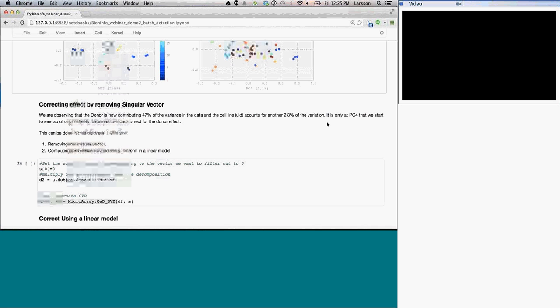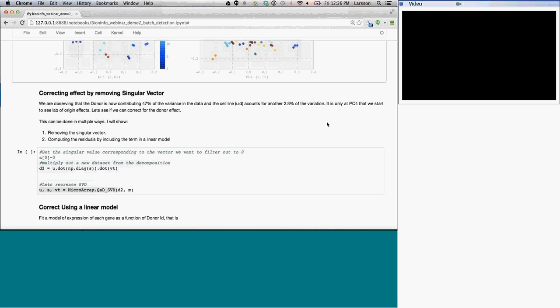Now, let's assume that we don't want this donor effect to be in the data when we do downstream analysis. We can include that in a model when we're trying to figure out differentially expressed genes, etc. But we can also correct for it up front. And what I'm going to show here is two different ways of doing that. One of them is we've done a singular value decomposition where we said the data set is equal to the product of these three matrices, where the first vector is highly correlated with donor effect. So one way I can do it is to remove that singular vector from the data set and recompute the data matrix with that vector set to 0. Whatever was captured by that first vector is then no longer part of the data.